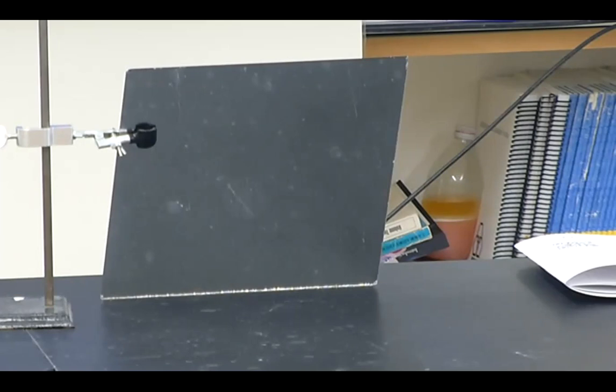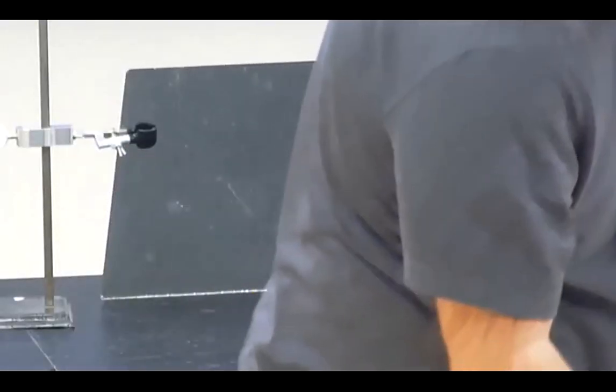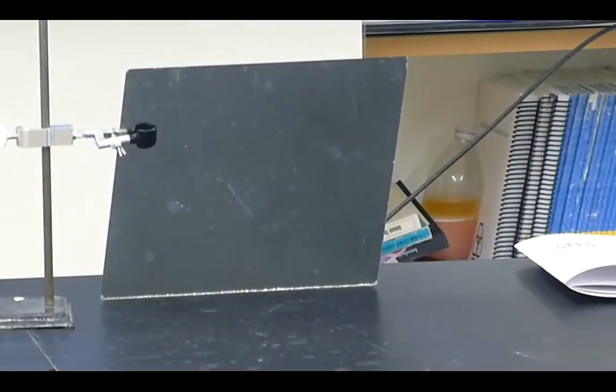All right, so tell your partner what you think this stuff is. This black stuff that's turning brown. What do you think it is? Take your best guess. All right, I have a guess for rust. I'll bring this over to the people that were here. You'll see it's now brown instead of black, right?